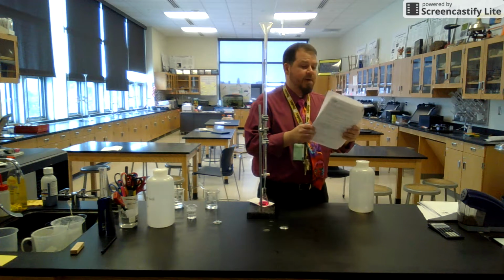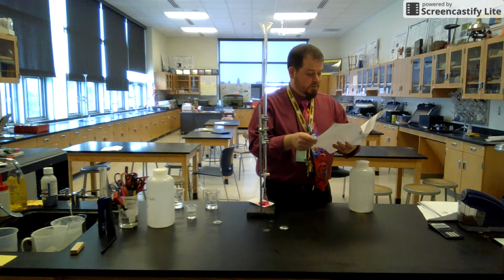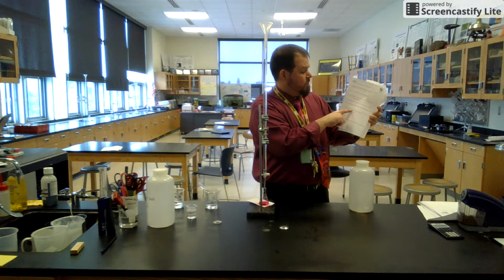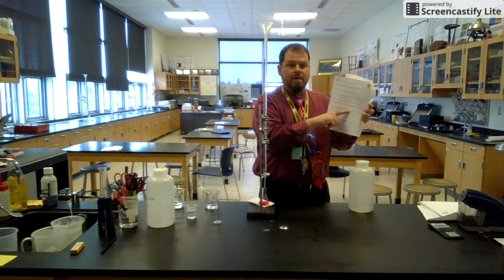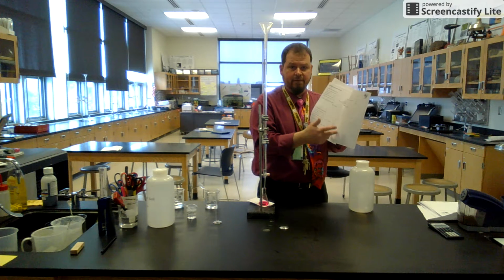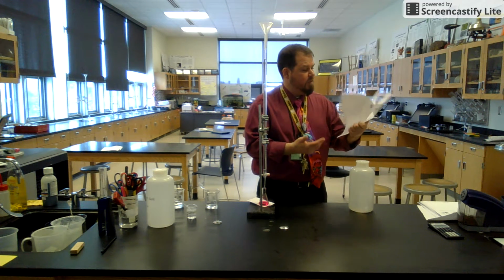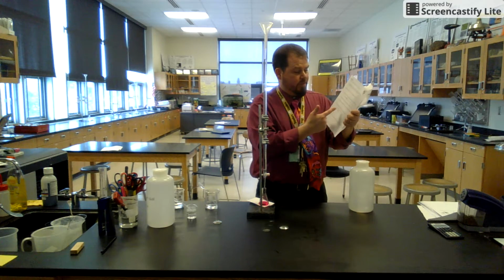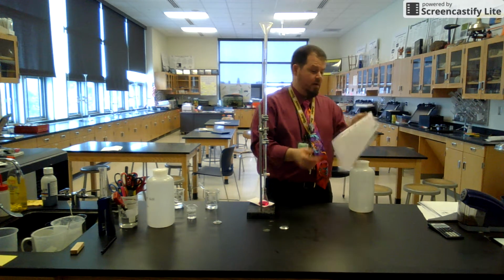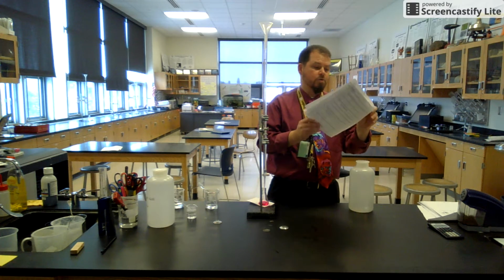There is a spot when you're done, when you have to come and see Mr. Milks, and I'm going to give you the actual concentration of the unknown acid. But I'm not going to do that until you have done all this work and figured out what the concentration is yourself. This way, now you can compare the known value to your value and come up with percent error for your interpretation of how well you titrate.